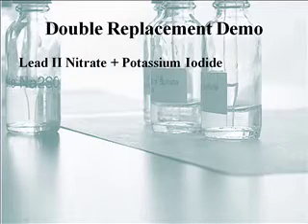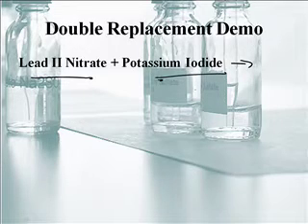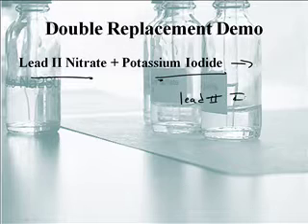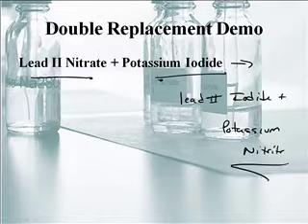There you go, Mr. Sams. That was cool. So this is the reaction: lead-2 nitrate plus potassium iodide formed lead-2 iodide and potassium nitrate. Now, we usually like to write the symbols rather than words. We'll teach you how to put all the symbols together in another podcast. This is just so you can identify and know which type is which.